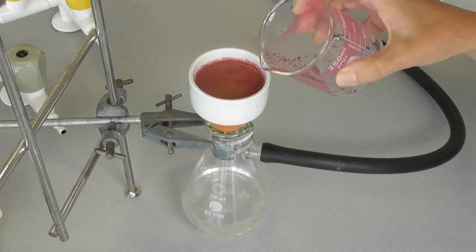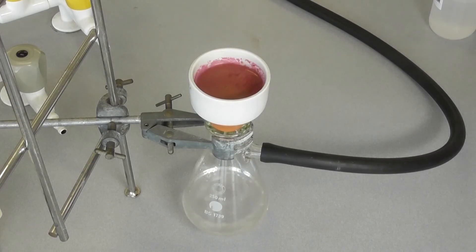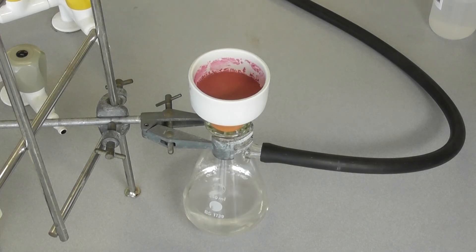The crude product has been collected in the funnel. Often there are soluble impurities still attached to the solid, so the product may need to be washed to remove these.